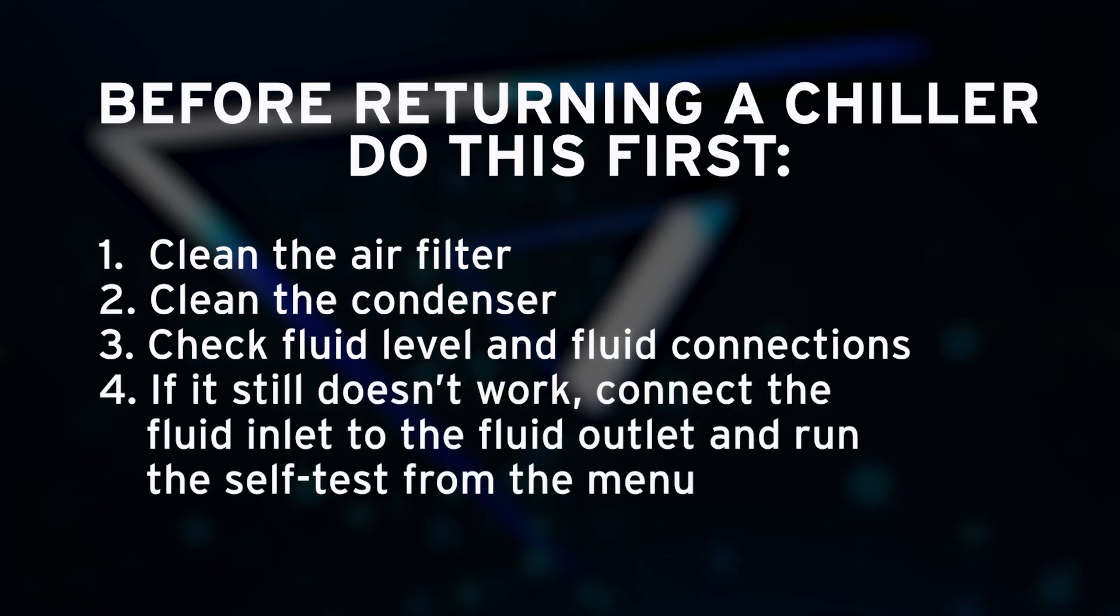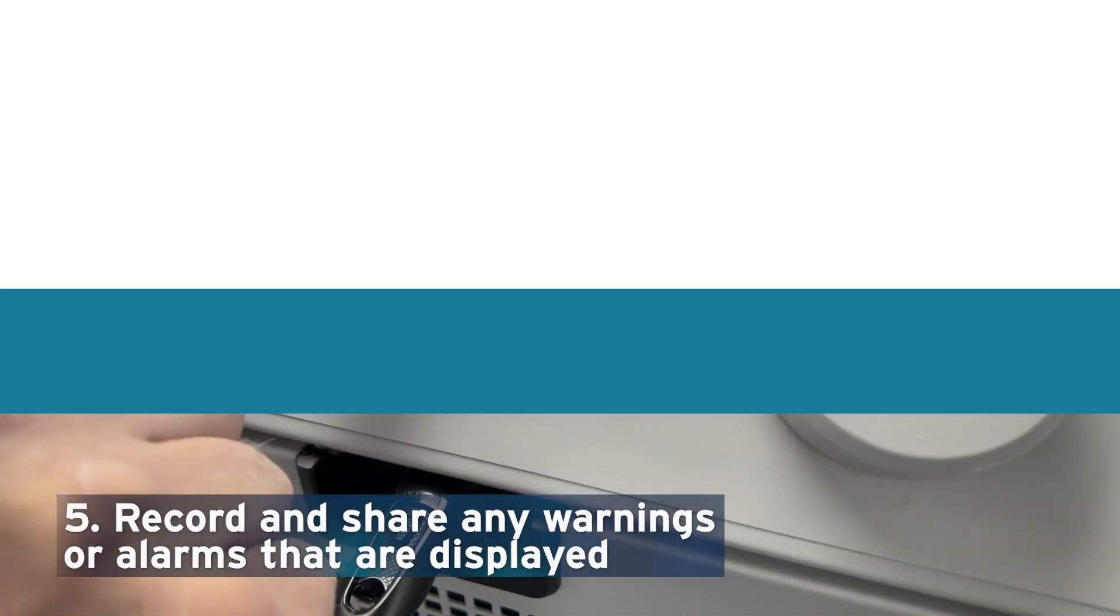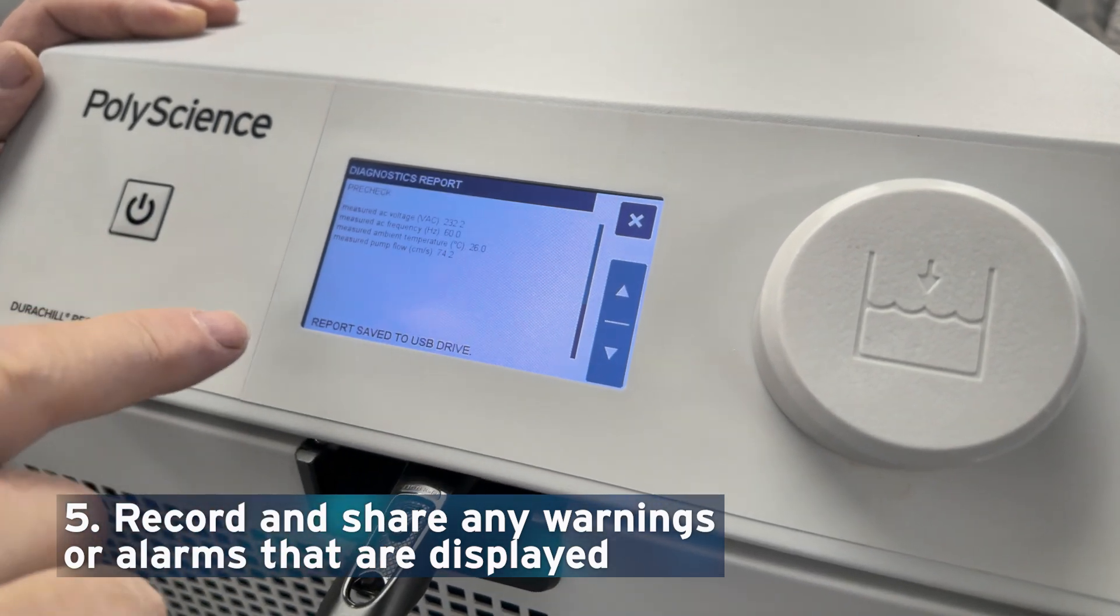If it still doesn't work, connect the fluid inlet to the fluid outlet and run the self-test from the menu. Record and share any warnings or alarms that are on the display.